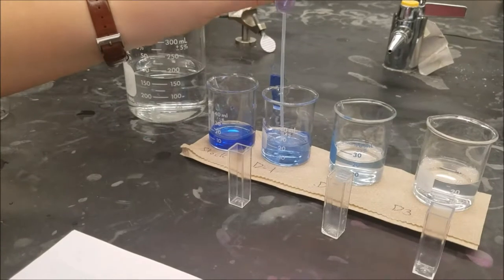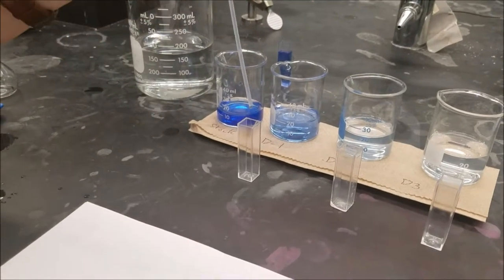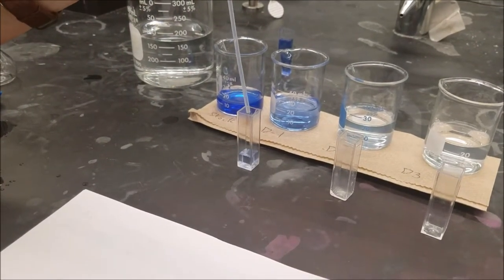Once you have made all of your dilutions, you will use the pipette to transfer an amount of each solution into a separate cuvette.